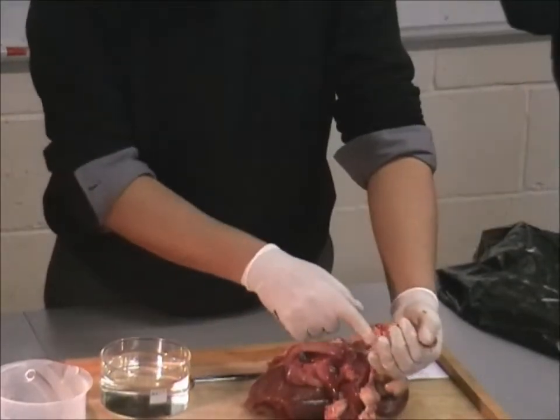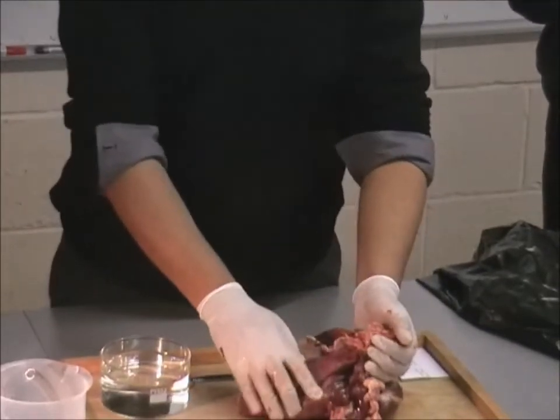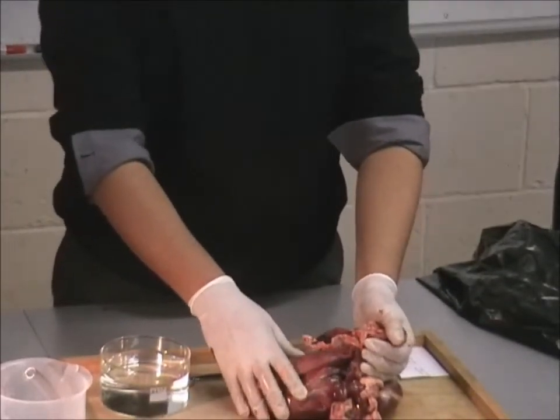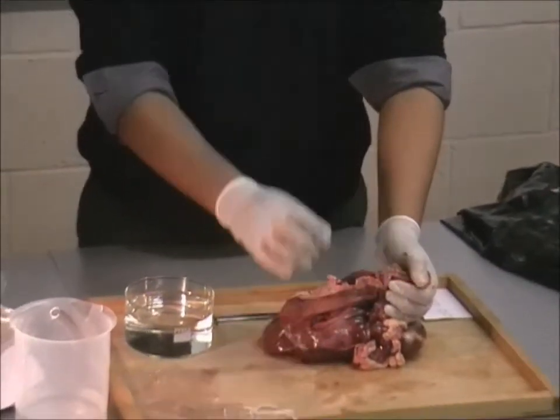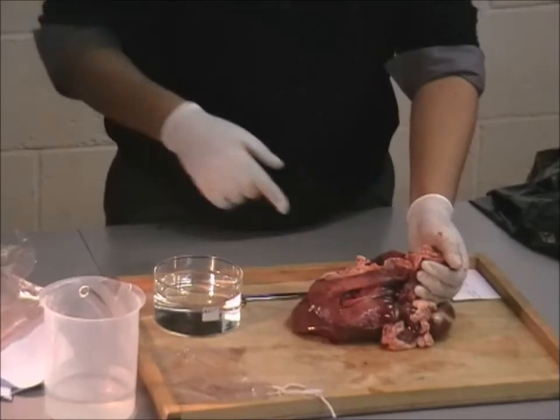I will start cutting towards this so you might be able to see the bronchi. What structure do you think you will not be able to see? Alveoli — because they're very, very small. You might see small little dots here; those are sort of the alveoli.